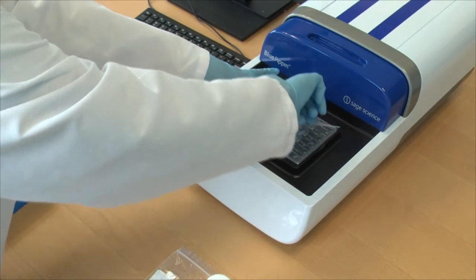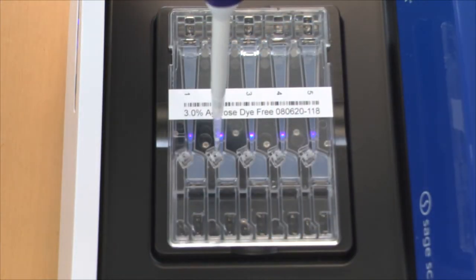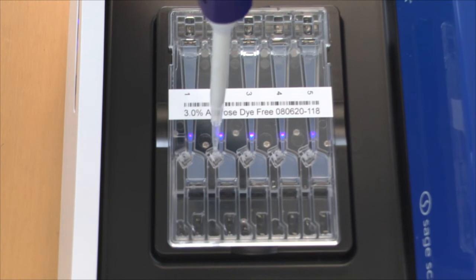The buffer must be replaced in the elution wells and then resealed with adhesive strips.